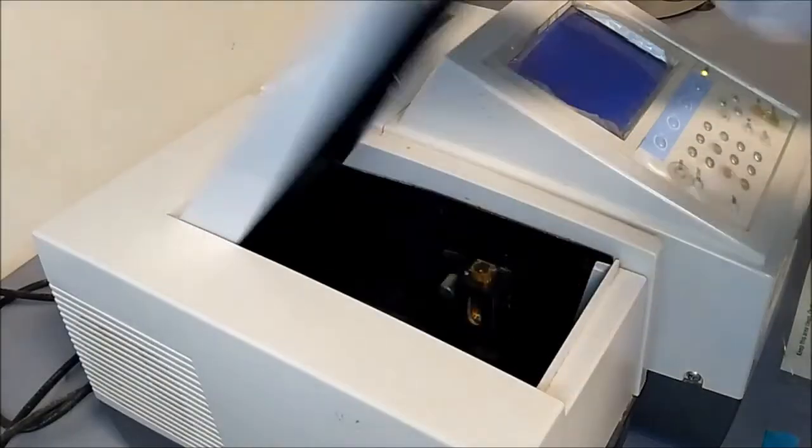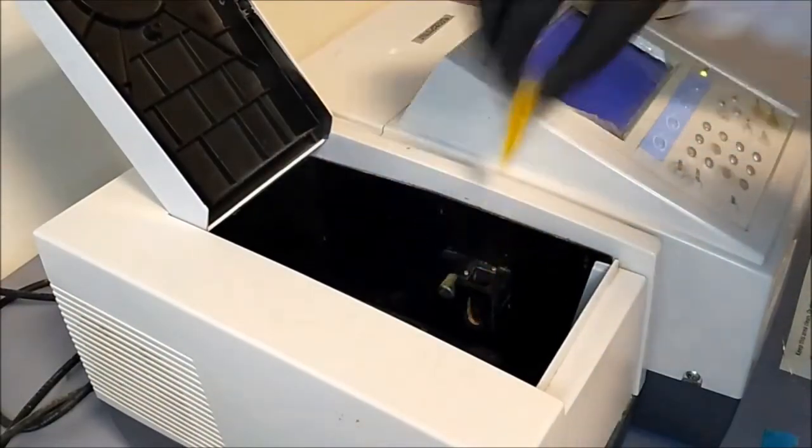Then, take out the blank and place the cuvette containing your sample.